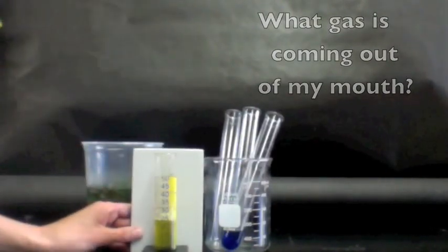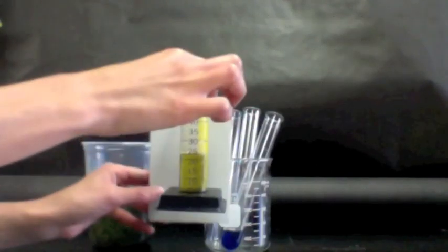Okay, so you should be able to see the color has changed now to yellow.